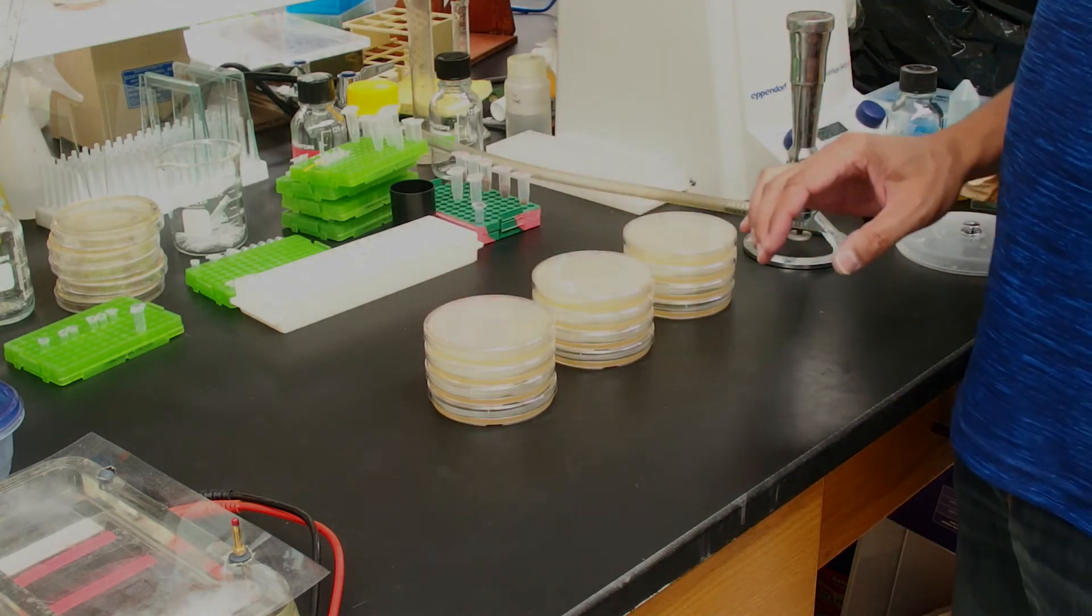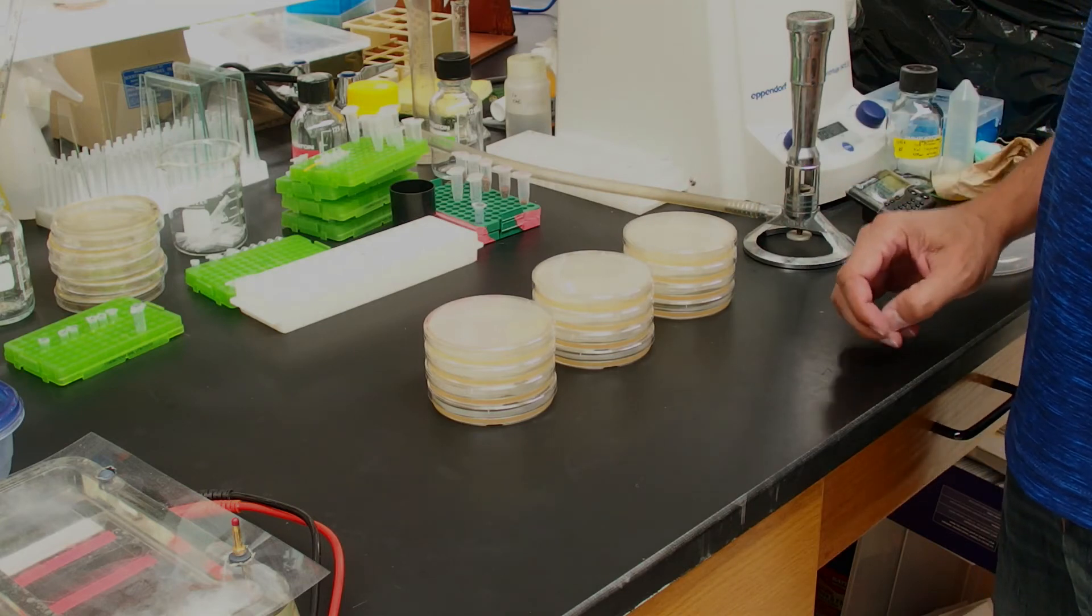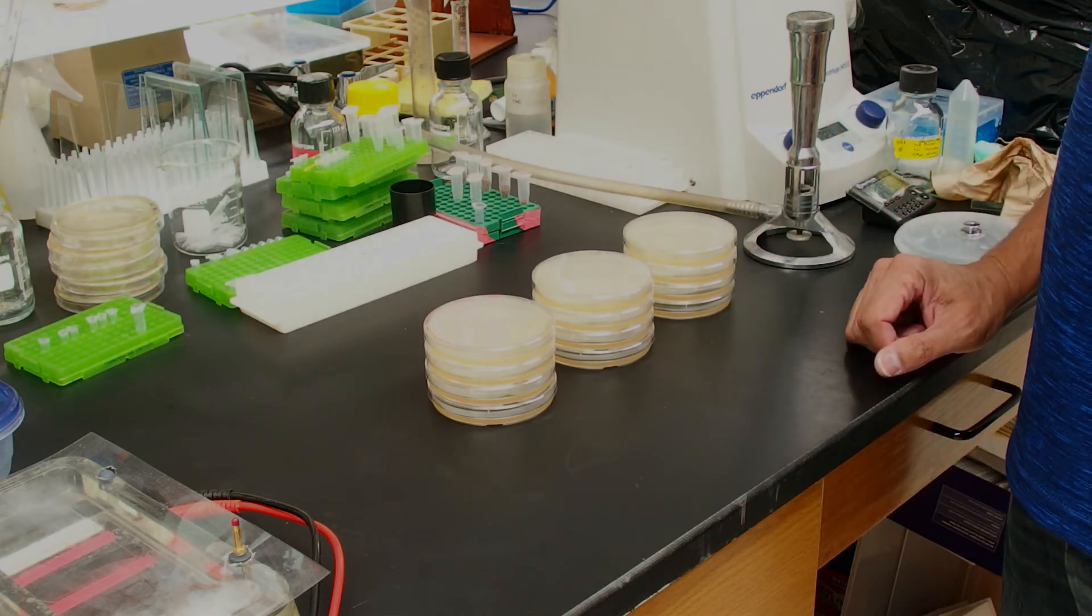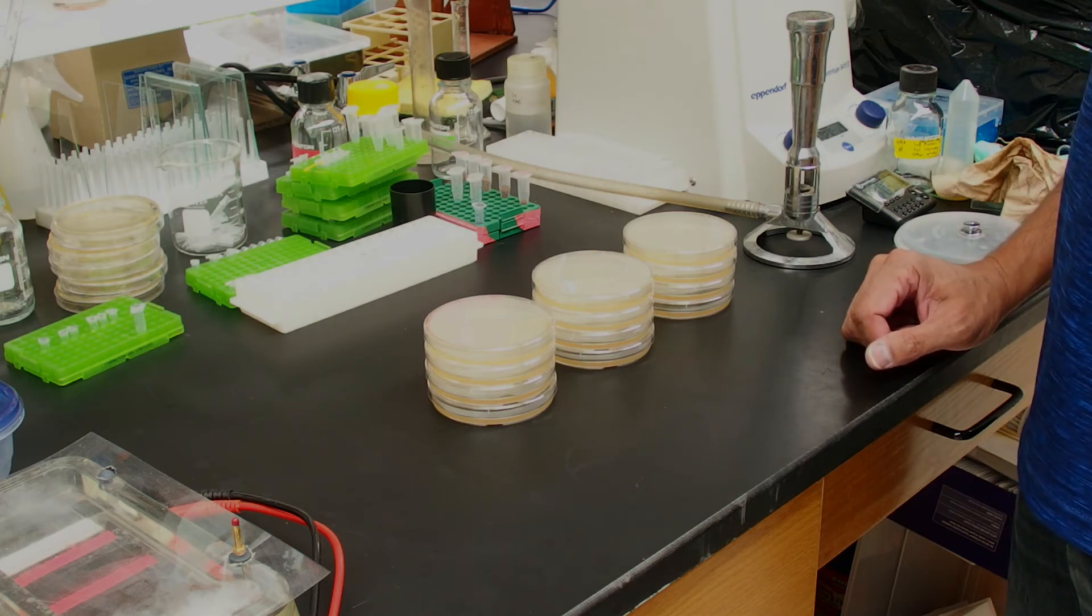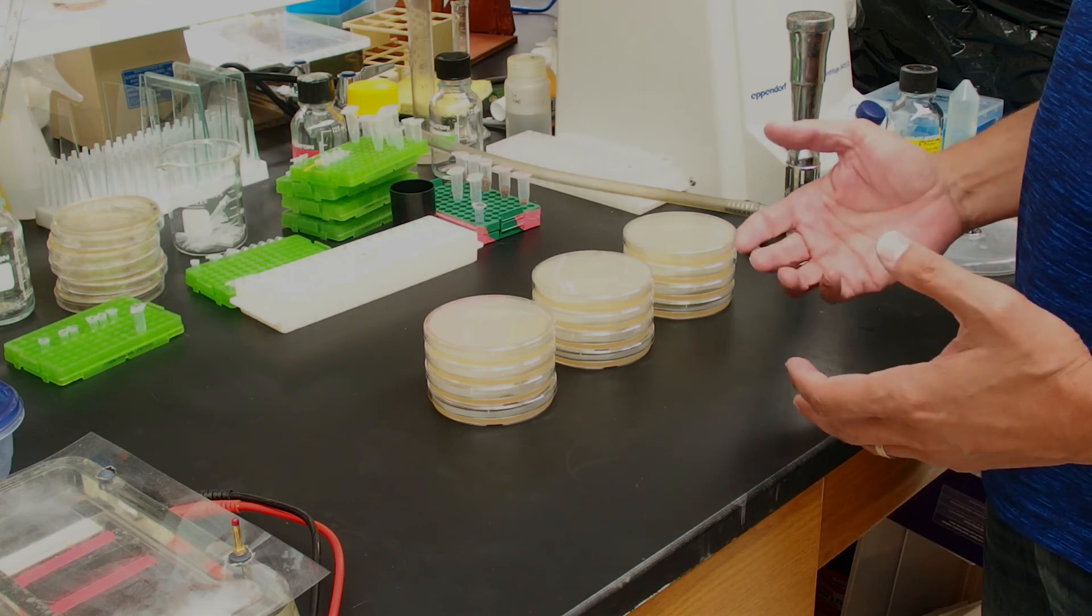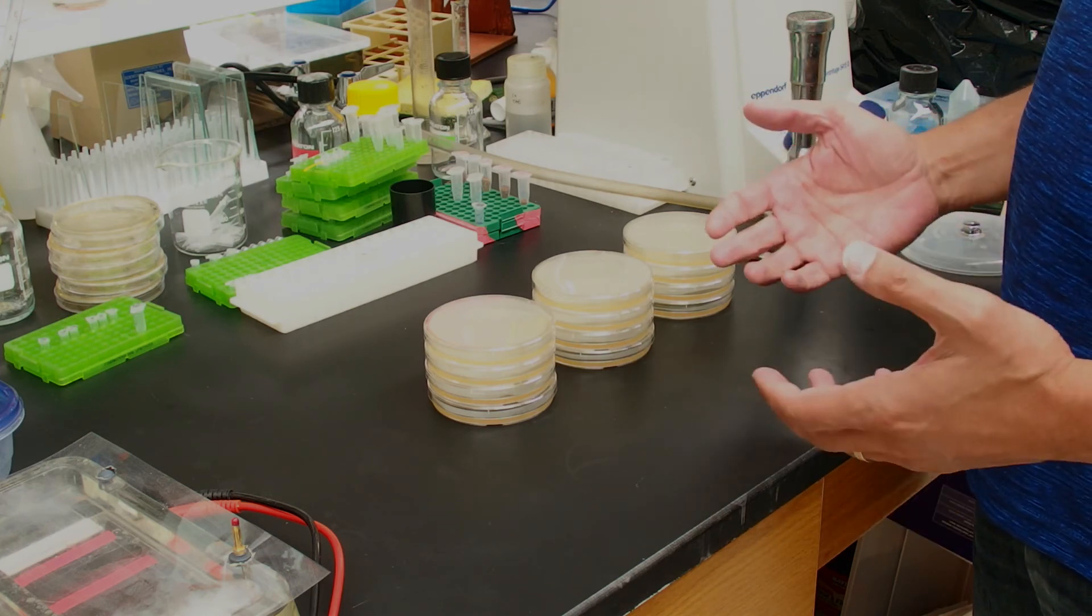We want to store these plates at room temperature for one day to dry out a little bit. And then we'll put them in a sealed plastic bag at 4 degrees and they can be stored for approximately a month. They'll continue working for about a month.